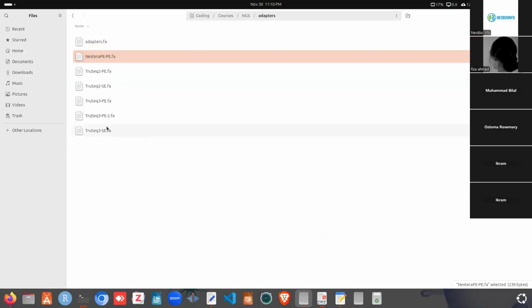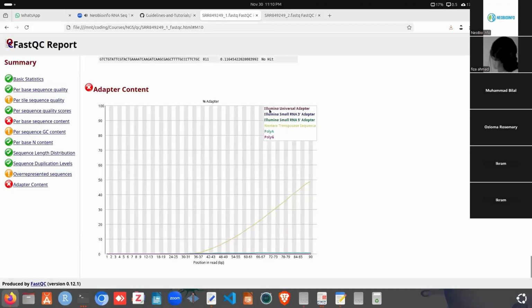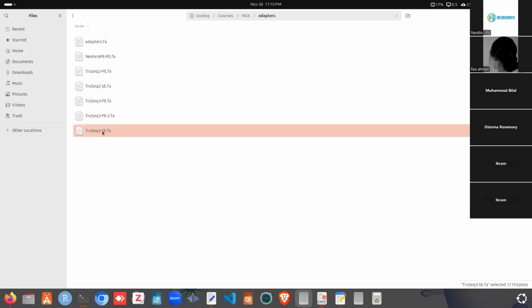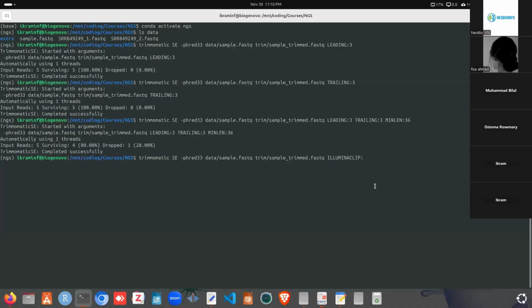And if we have any Illumina sequencing, Illumina universal adapter, that is this one, then we can use this one, the TruSeq2 for the single-end mode and TruSeq3 for the paired-end mode. So our adapter file path is in adapter. After ILLUMINACLIP, then the path to the adapter file, then we need to specify the seed length, then the palindrome clip threshold, and after that the simple clip threshold.